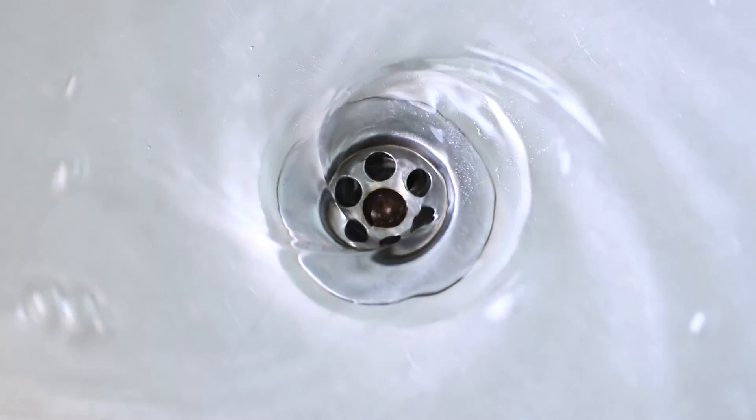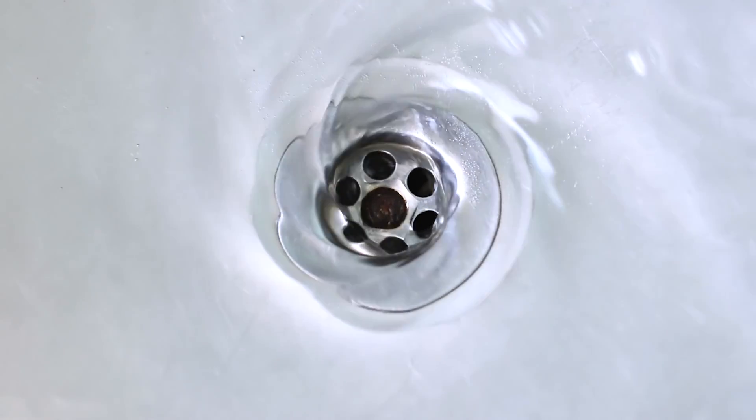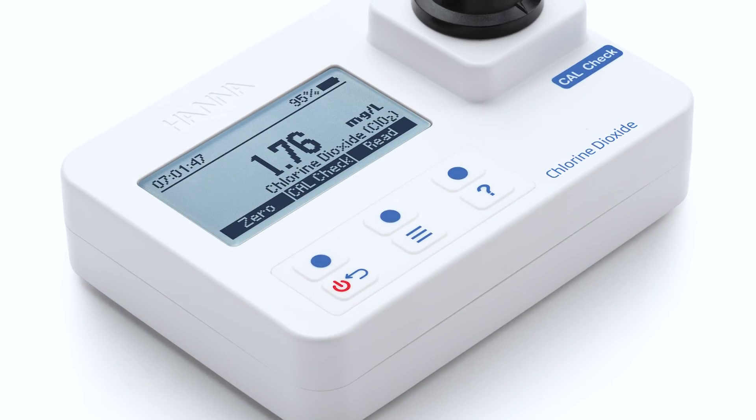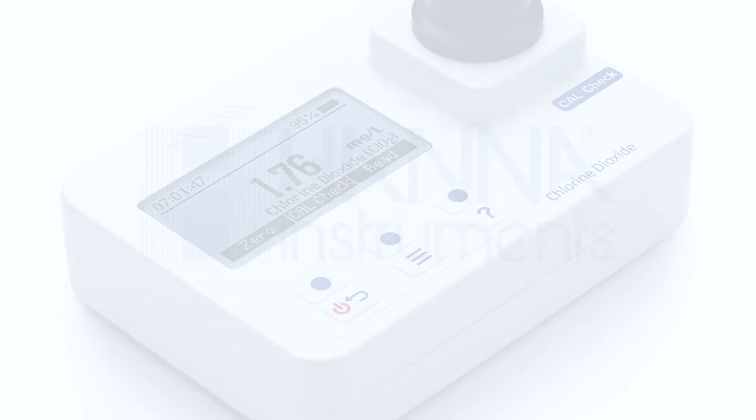Once the measurement is finished, dispose of your samples in accordance with local regulations. The next sample may now be taken. Happy testing.